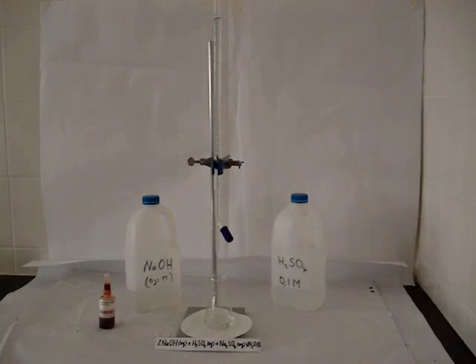We're going to add the sulfuric acid, drop by drop, to the sodium hydroxide until the endpoint, when equivalent amounts of sodium hydroxide and sulfuric acid have reacted to completely neutralize the solution.